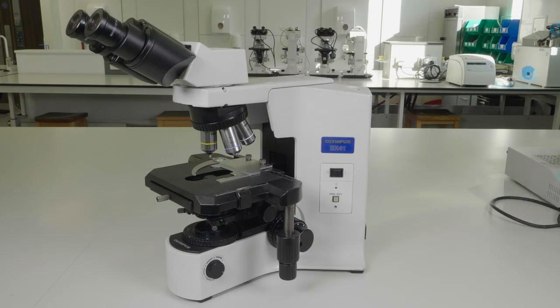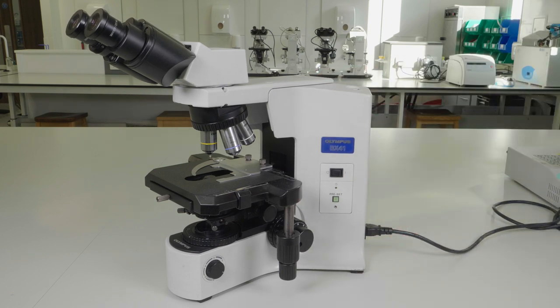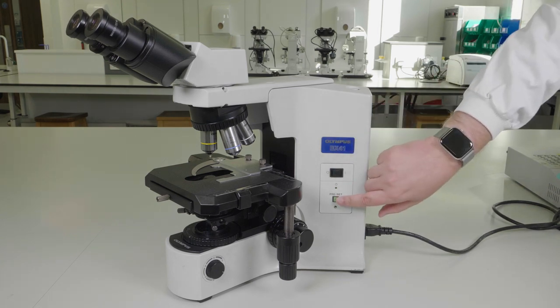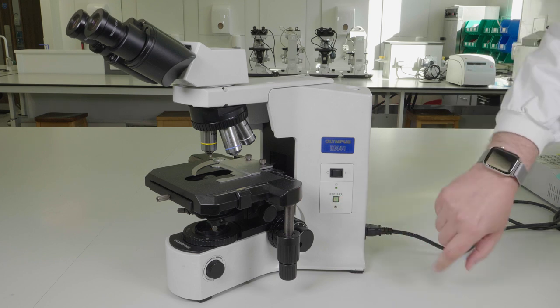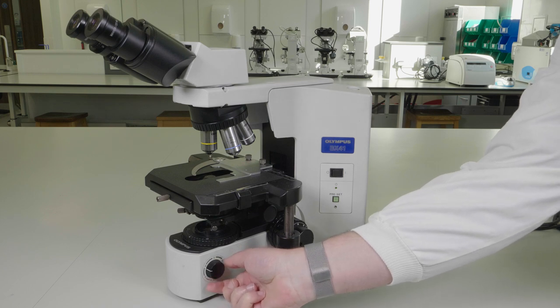First let's plug the microscope into the power supply and switch it on. Underneath the power button you will note a button marked preset. Make sure this button is switched off before continuing. Set the light intensity to approximately four volts.